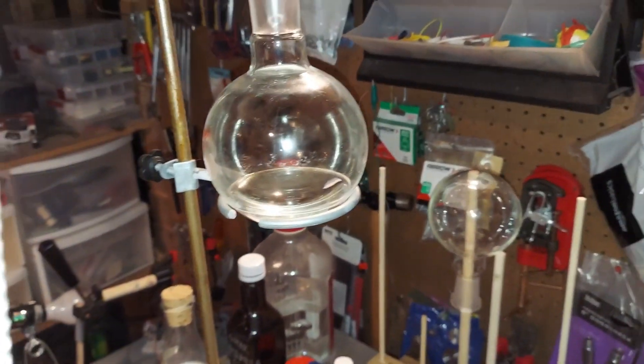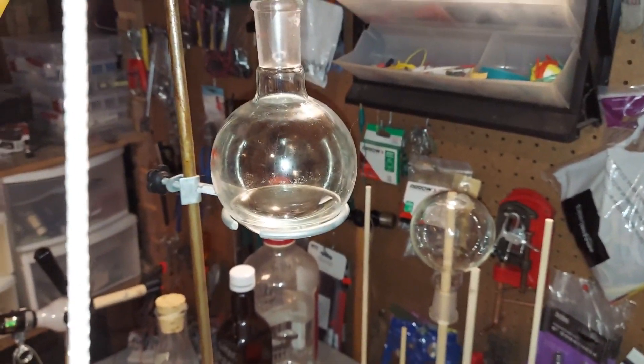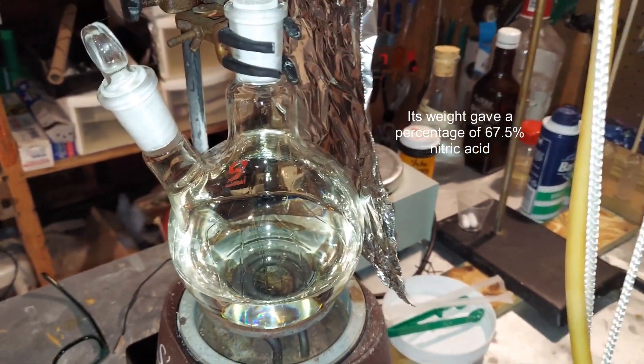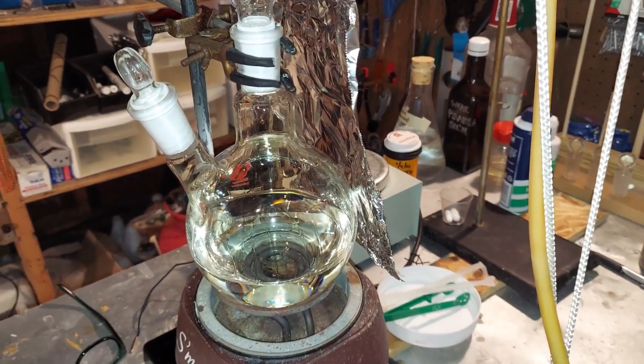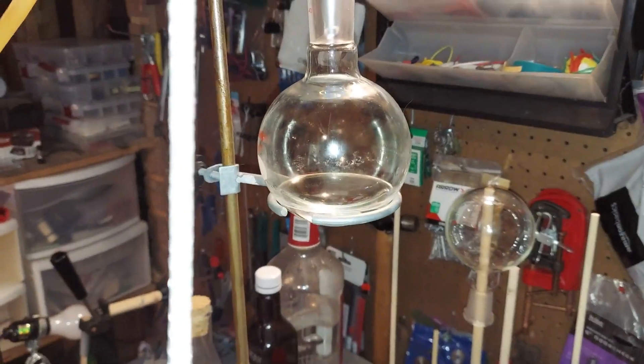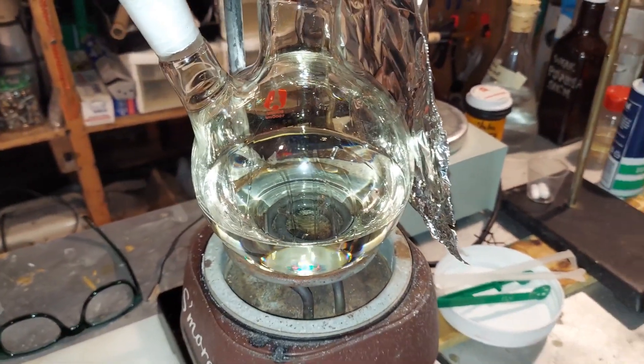I'm going to take a little bit out of what came over and measure its specific gravity. And also from here, and if they're the same, I'm done. If they're not, I'll start it up again, meaning that this still has more water than this.